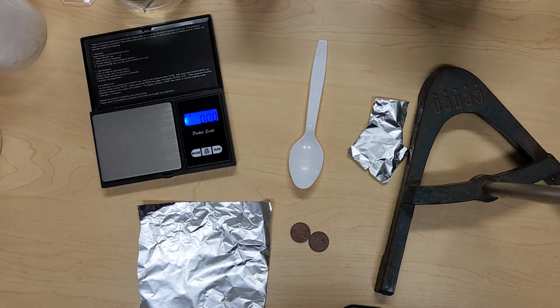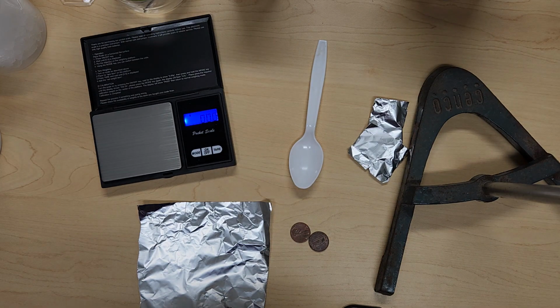All of the waste materials for this lab will be able to go down the drain with water, so there are no hazardous materials that are produced. Okay. So we are going to start by thinking about contamination. As we're carrying out these procedures, make sure that between substances you're cleaning your equipment.